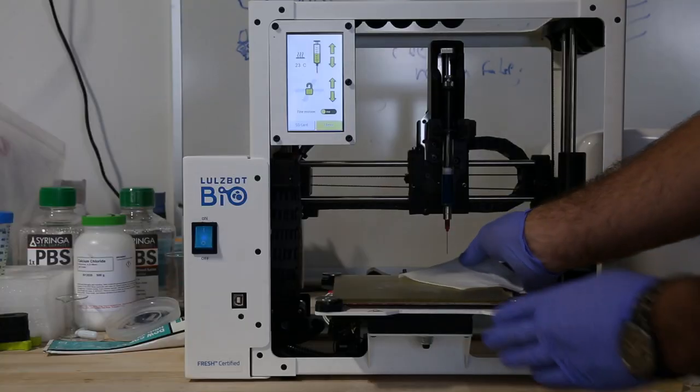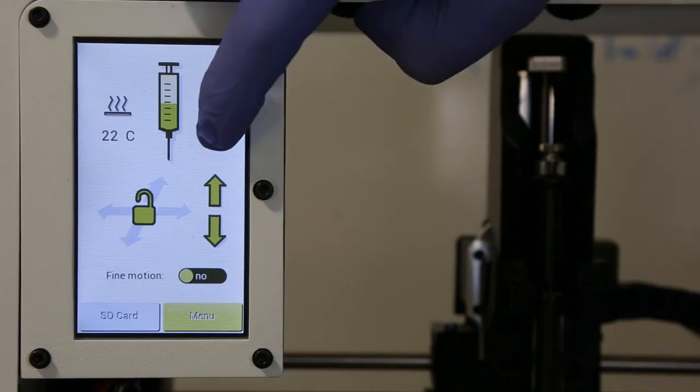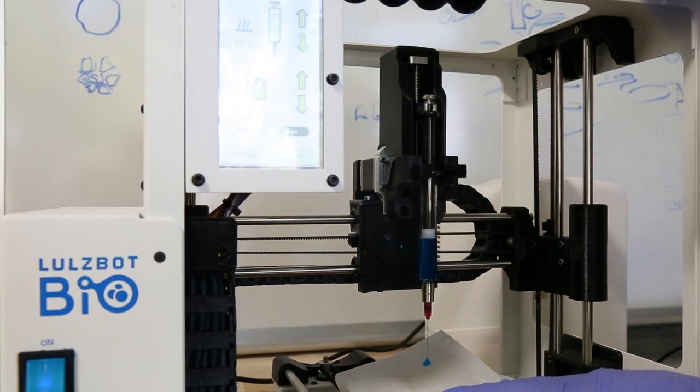And then we're gonna extrude a bit from the syringe pump so that the needle is primed and ready to print.